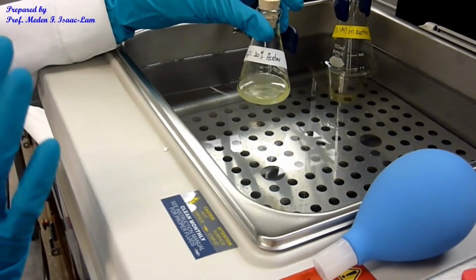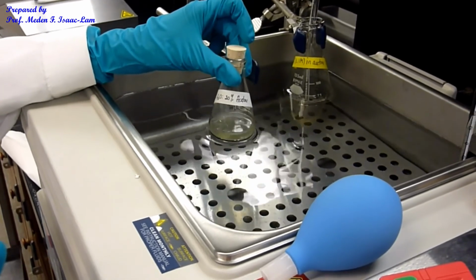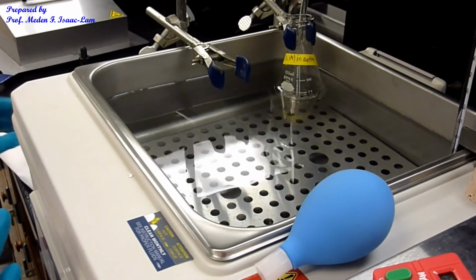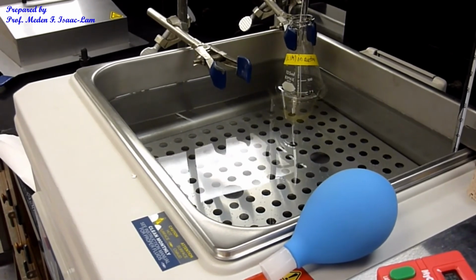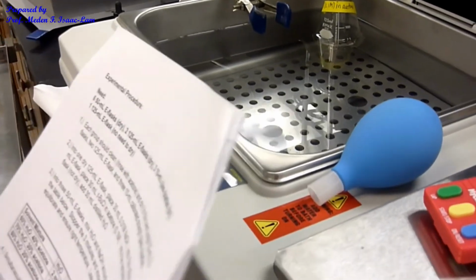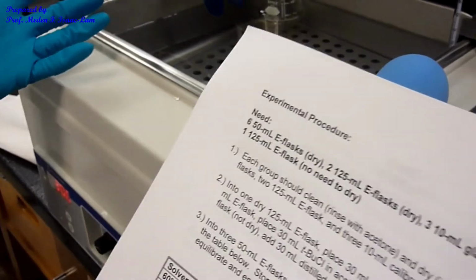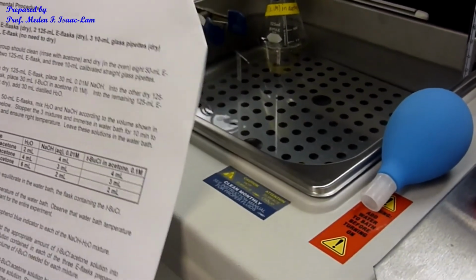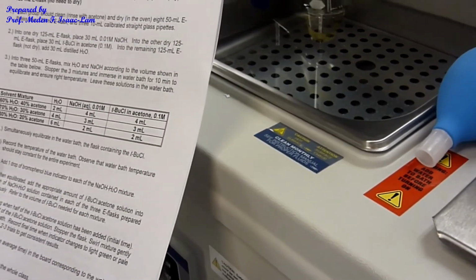Right? So after this, it's basically clean up. However, as I mentioned, typically we will have 2 runs. So I showed you an example on how to do it, and then I will give the data for the rest of the class. Typically the class shares the data.